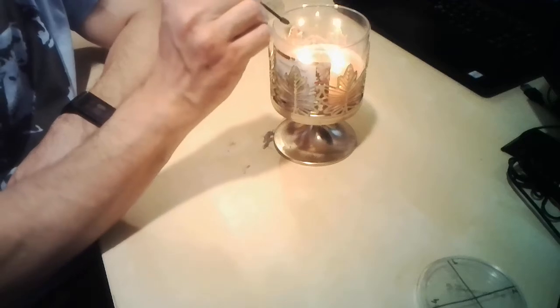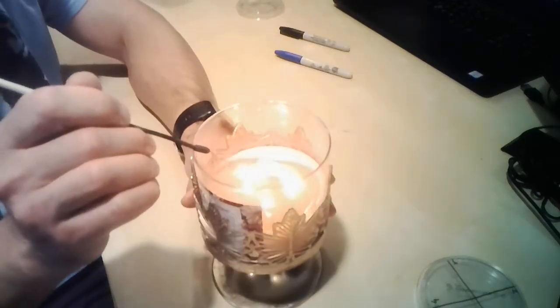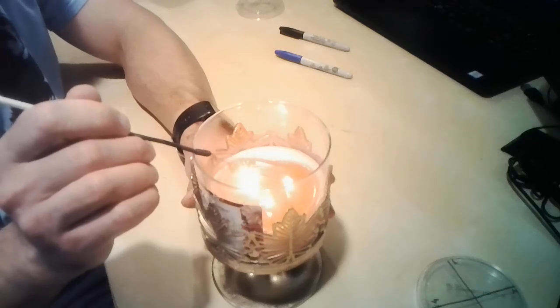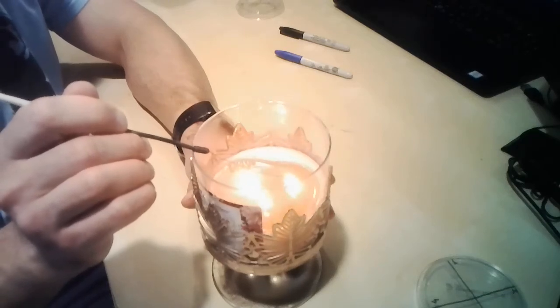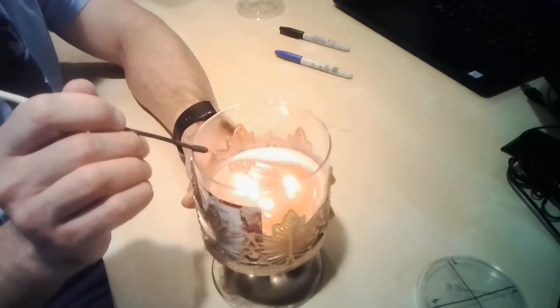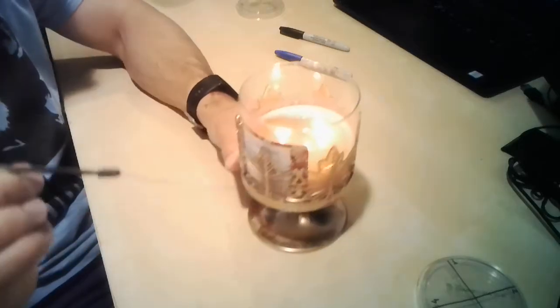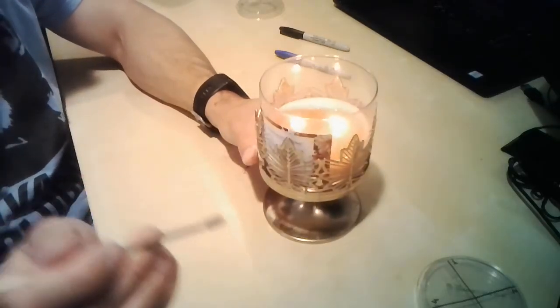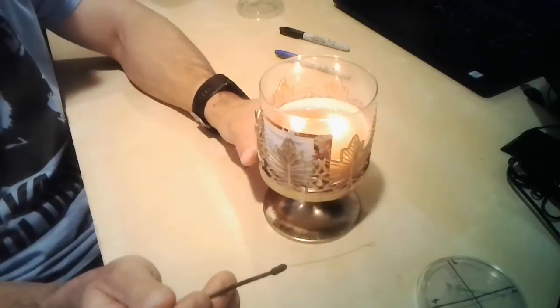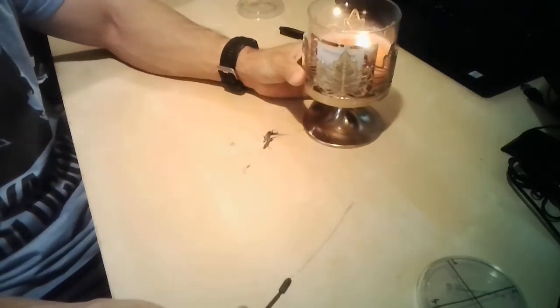Well, you didn't, so let me try and show it to you. I just want to make sure. So this is what I do. It's really hard to sterilize, the flame's not really stable. Let's see if you can see it. Well, the camera doesn't focus that well, but believe me, it was red hot. Okay, I can put it a bit to the side.